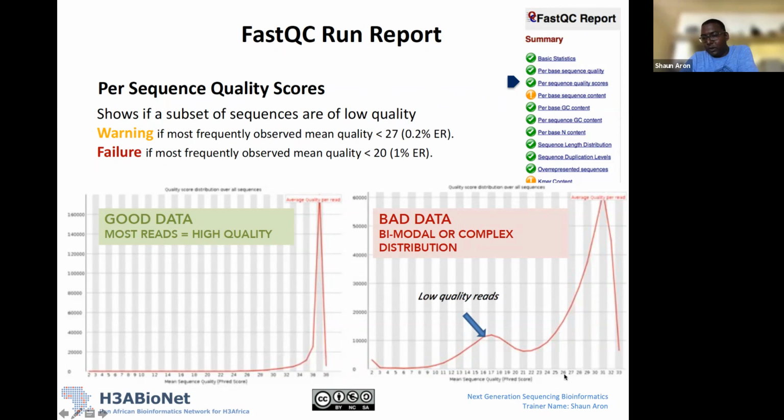Which is tending towards the higher scores, between 20 and 30, we would expect to see just this one peak. This is saying that the majority of our sequences in our FastQ file have a mean sequence quality score of between 25 and 33, okay? That would be this peak here. We don't expect to see this one, but this one is saying that we have a significant amount of reads in our data set where the mean sequence quality score is not anywhere near 30, it's actually between 14 and below 20. So this is showing that we have a lot of low quality reads in our data set. This is what we expect to see and what we should see in our data set. And this is the data set where something strange is going on. That's why you're seeing these two peaks. Hopefully that answers that question.